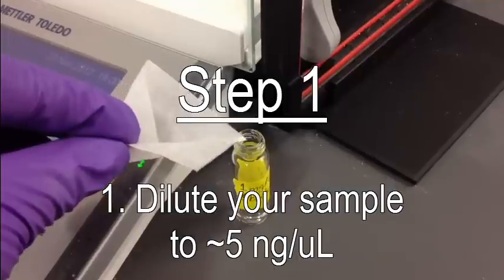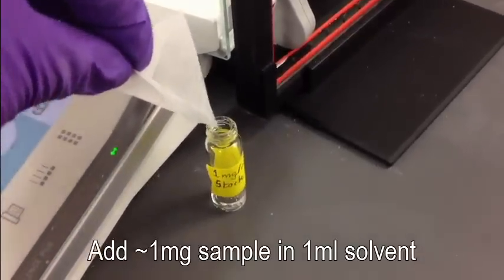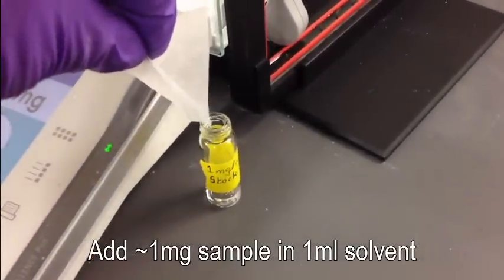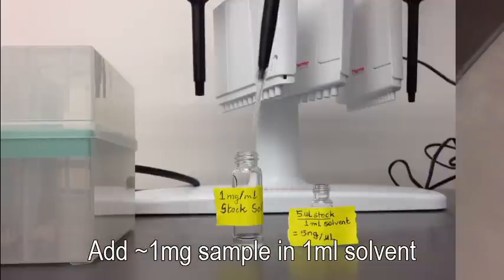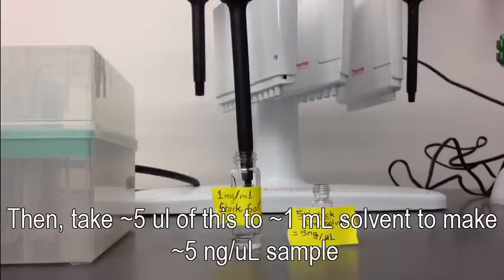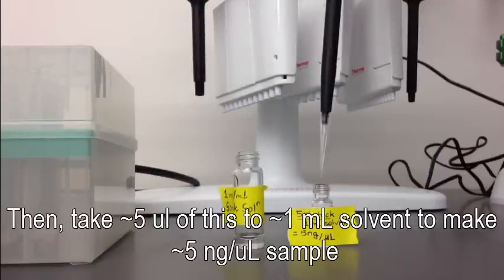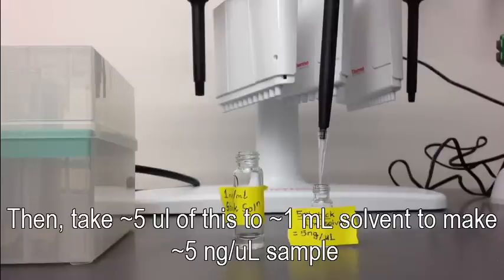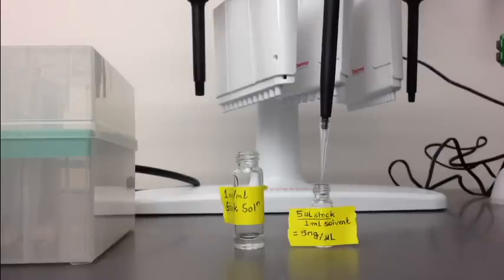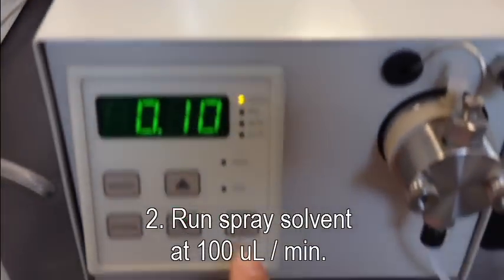First, prepare your sample. Next, run spray solvent.